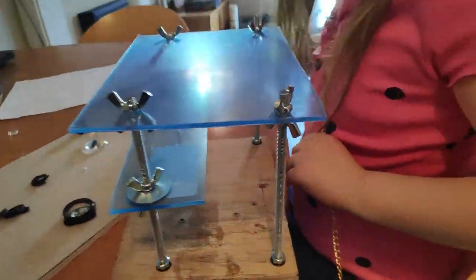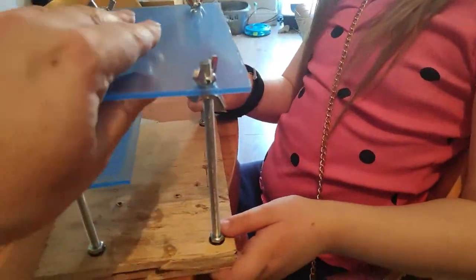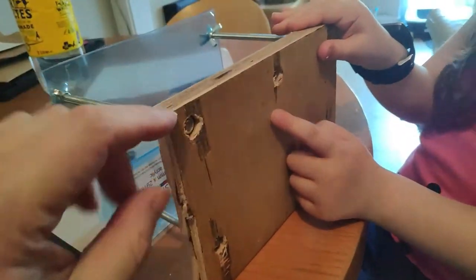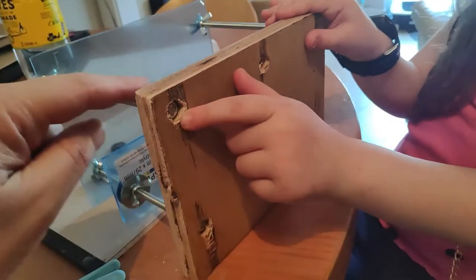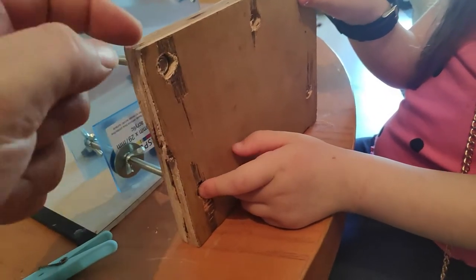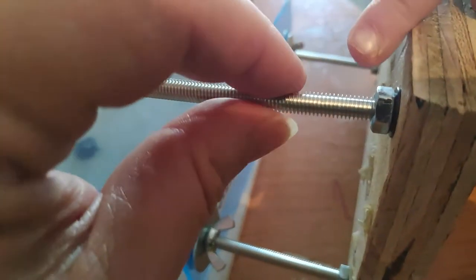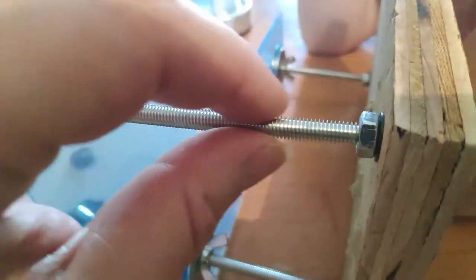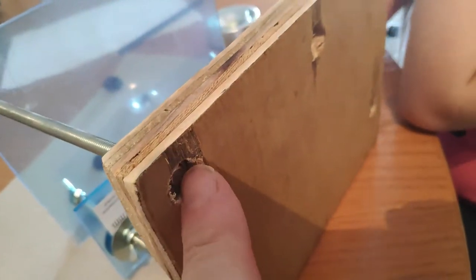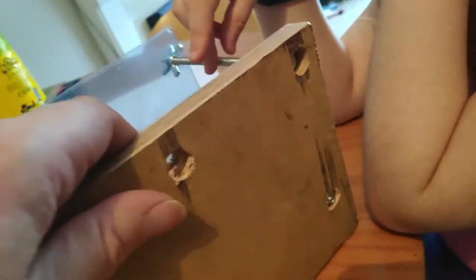Can we show how we made this microscope? Yes, we can. So let's first of all turn it over. We cut a piece of wood, then we put some bolts cut to the right length, and some nuts — but we had to countersink these. So you drill one hole through the size of this stud bar, and then use a bigger drill to countersink the holes so it all sits flat.